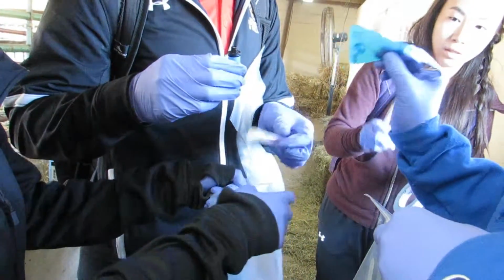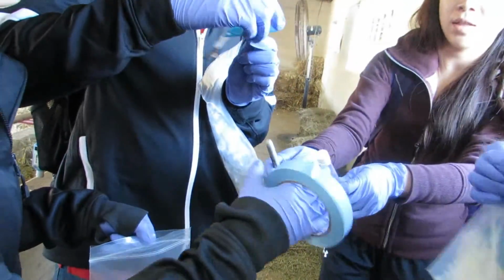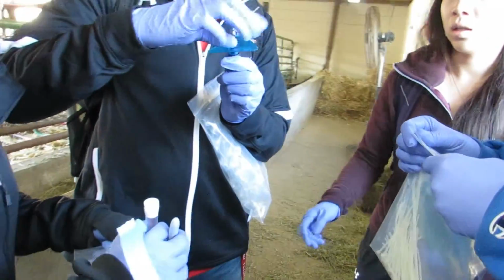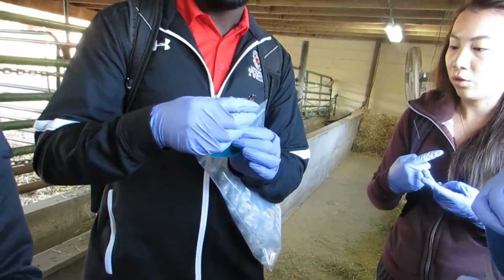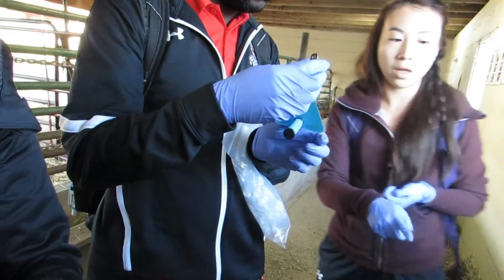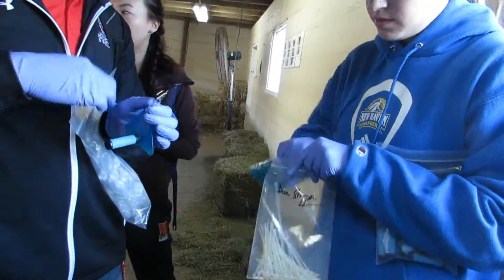Each empty radiello tube and each diffusive body was labeled with the sample number and location. Once all 3 samples were ready, they were hung in the desired location. Some were not easily accessible, as the sample is severely affected if it is touched. For each sample location, a blank was also collected.